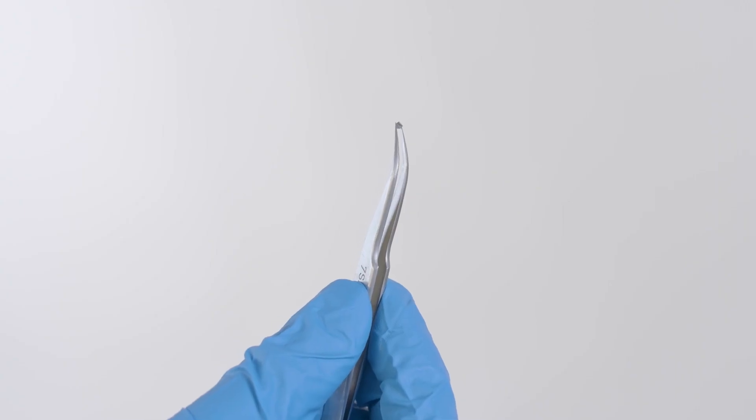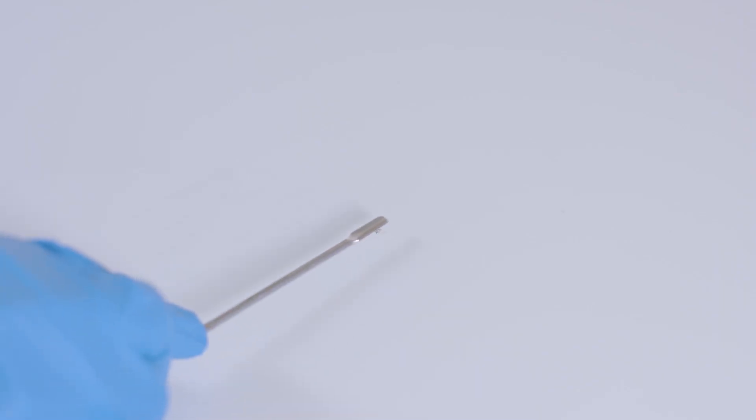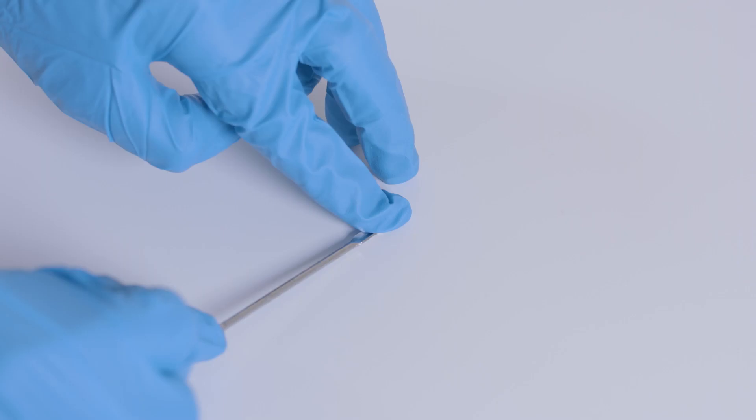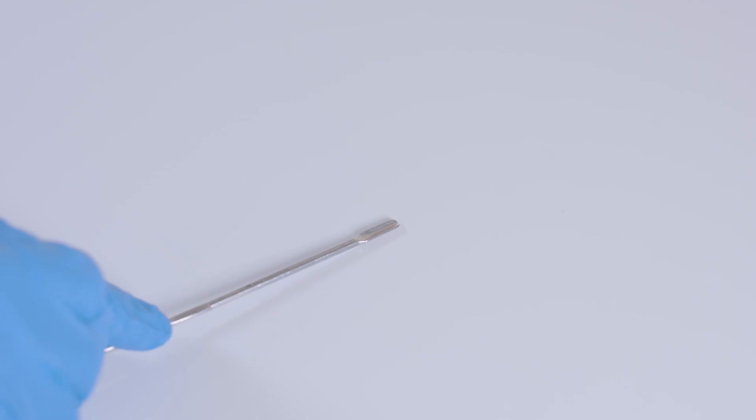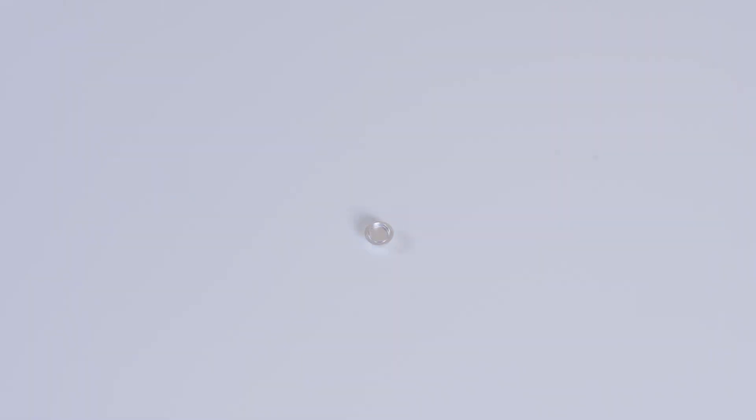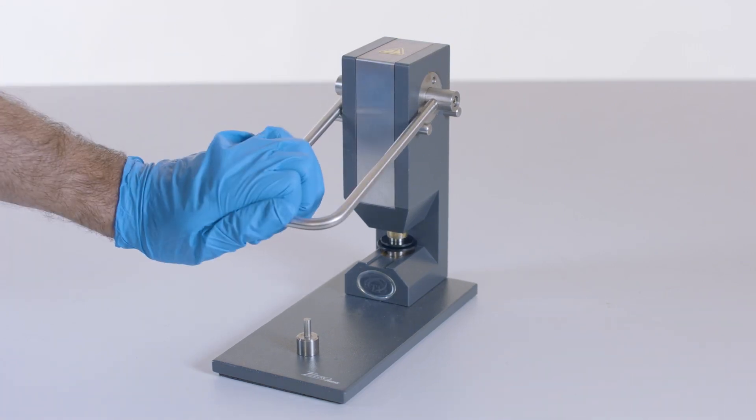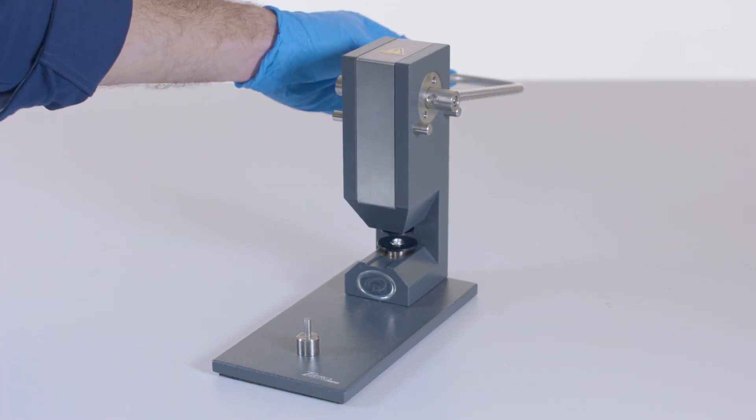To start, use 4 to 5 milligrams of indium. After weighing the sample, use the spatula tip to flatten the indium sample, which will enhance the contact between the sample and the bottom of the pan.